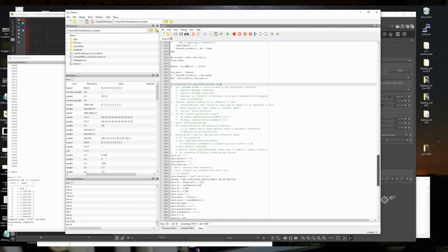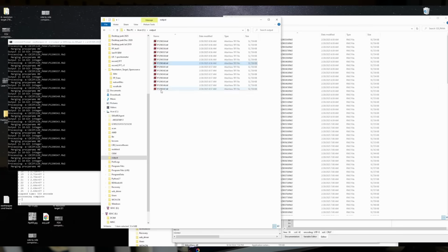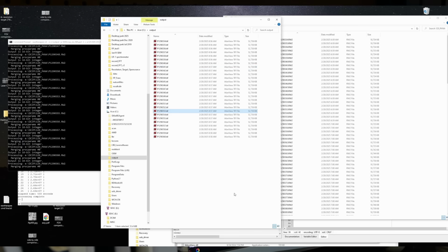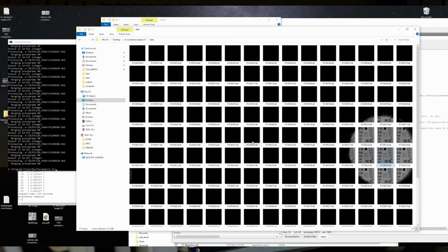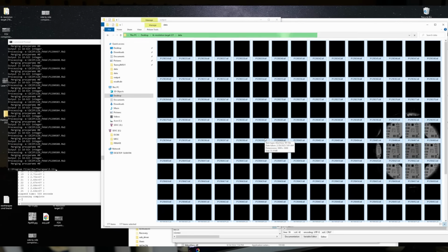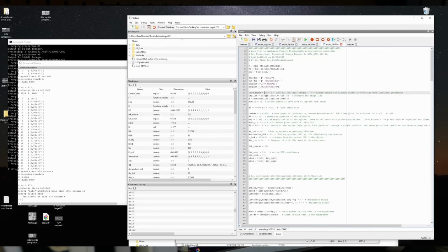After we get to the actual algorithm, all of this stuff gets pumped into the algorithm, and it takes all of these images and fills up Fourier space with all of the Fourier transforms of the input images. You can think of it like filling up a grid where each image that we acquired is a different place in Fourier space. So it puts all of these images together, stitching them, and overlap is important to make the stitching process easier. And then once it's stitched together all these images in Fourier space, it takes the inverse Fourier transform of that to go back to a final output image.